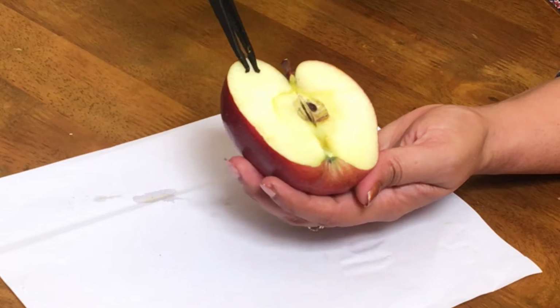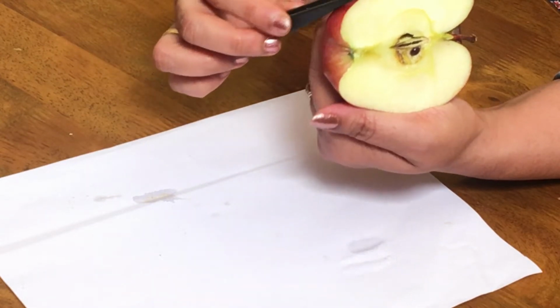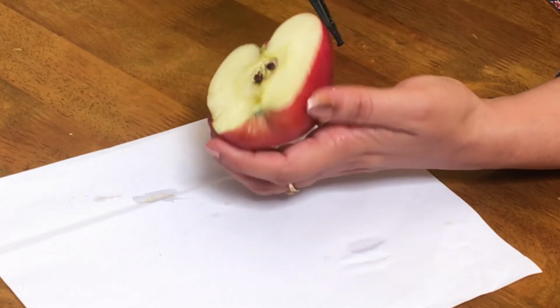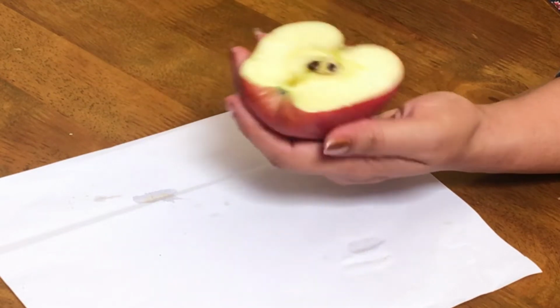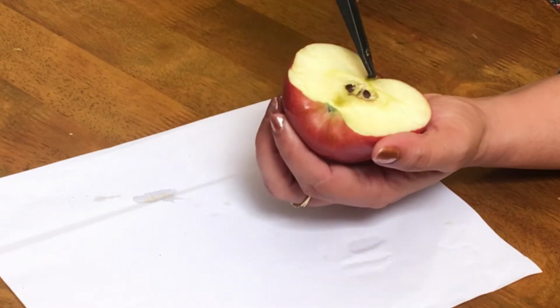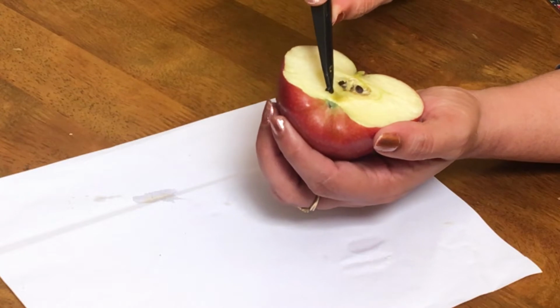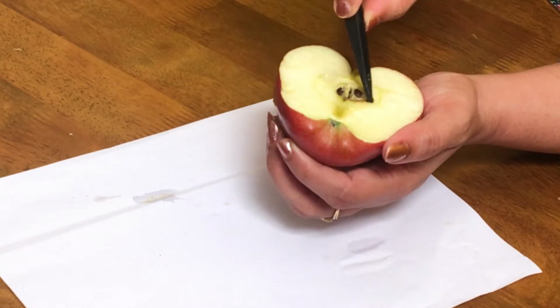The thalamus has enlarged like this and became very fleshy, and the outer part of the thalamus became colorful like this, red in color because of the red color pigment. So this is the thalamus part. And where is the fruit? This is the fruit wall. You can see here this part, this is actually the fruit part of it, the pericarp.